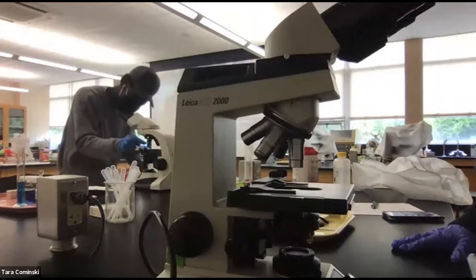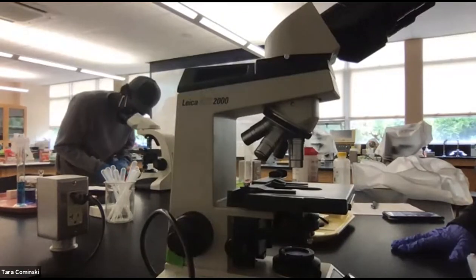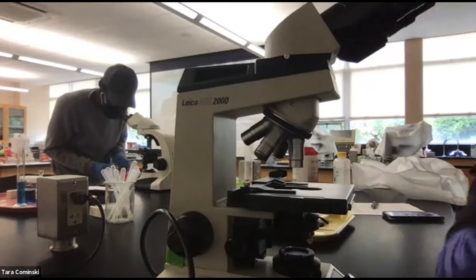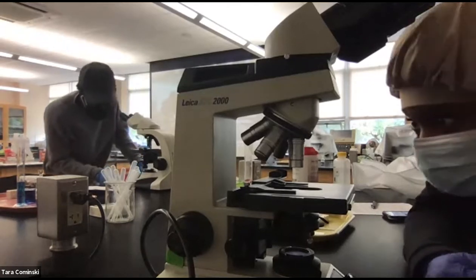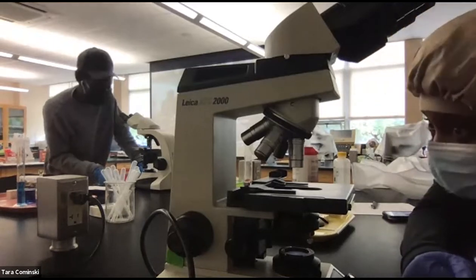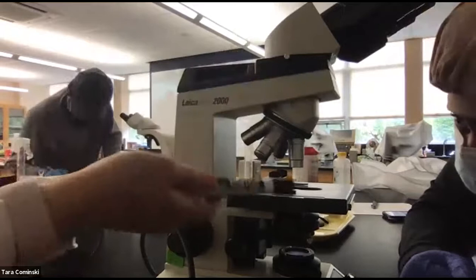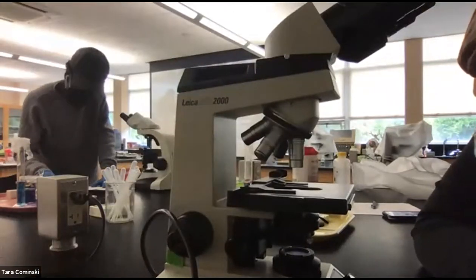Okay. So then I asked you, what's the magnification of that scanning objective? So take a look at it. Sometimes you can see it actually on the side of the objective. It's labeled. This one is kind of erased, but I think this is 43? No, it's 4, right? Yep, it's 4. So the magnification of this scanning objective lens is 4x.